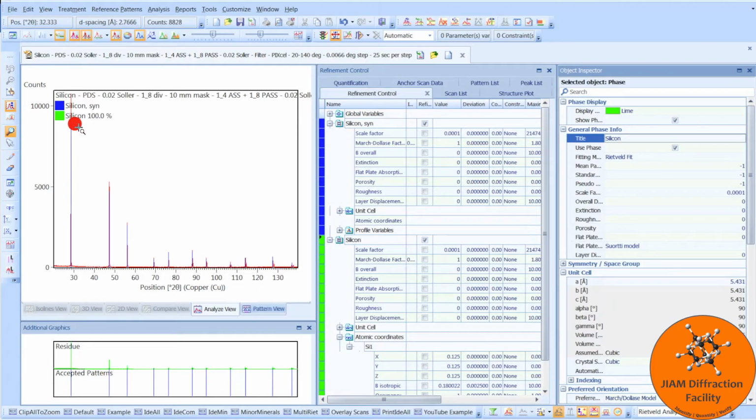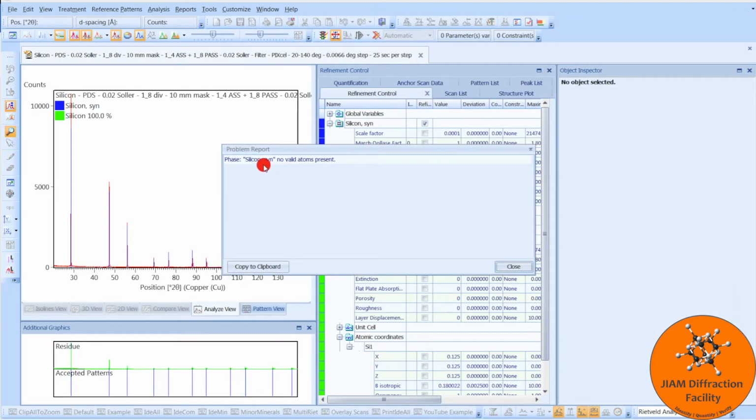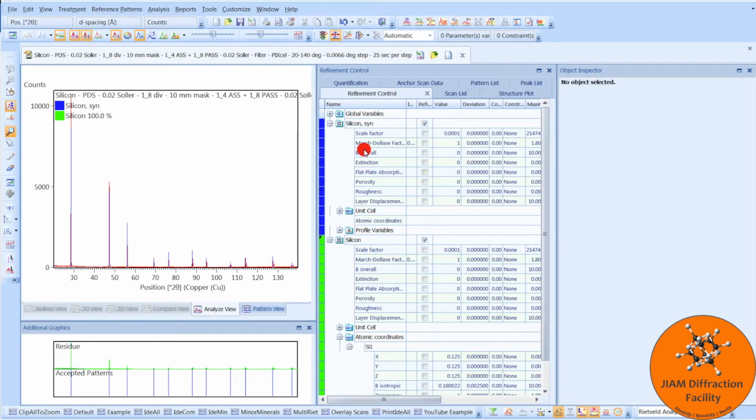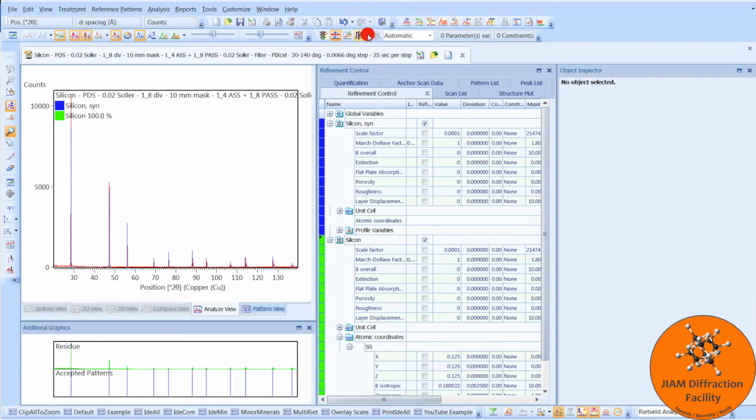Now we would be ready to refine this phase. We would first want to delete this phase because it doesn't have atomic coordinates in it, and that will give us problems. We can see that if we try to perform a refinement, you'll get a warning that no valid atoms are present for this phase. So if you wanted to refine this one, we would just delete this and then go ahead and do whatever refinement parameter set you want to use. But let's now look at the other option for solving this problem.